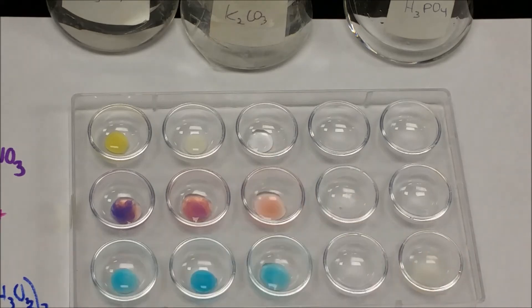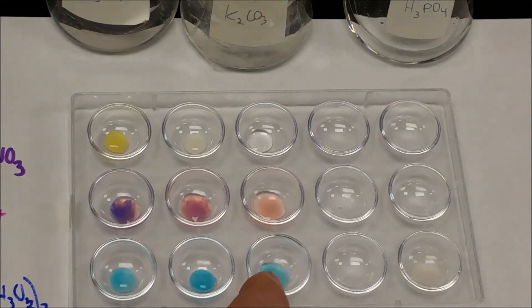But phosphoric acid didn't work for either one of those. So if that's what you're checking for, then you have to eliminate everything else except for water and then check it to see if it precipitates with the copper(II) acetate.